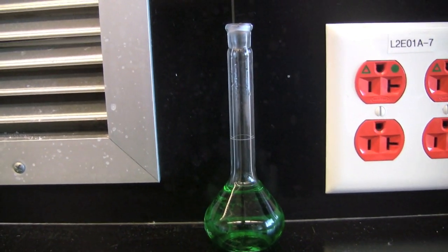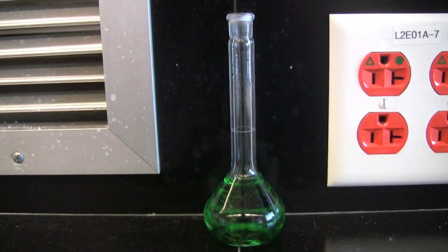Next, you will fill the volumetric flask with more water until you reach the 50 milliliter line which is located here.